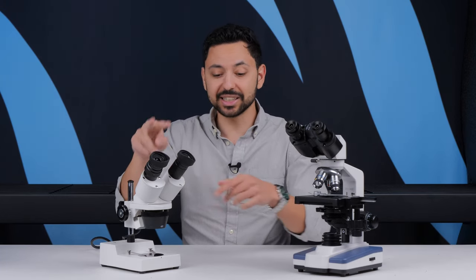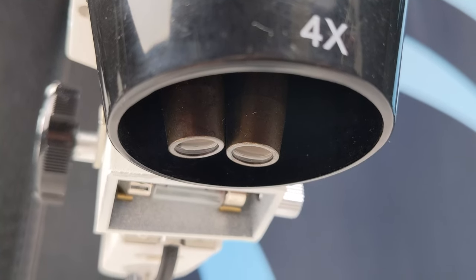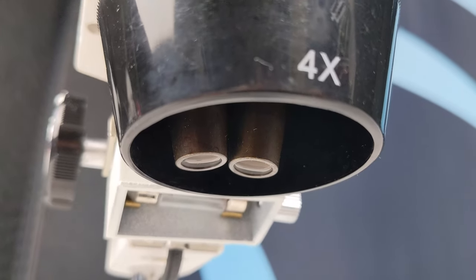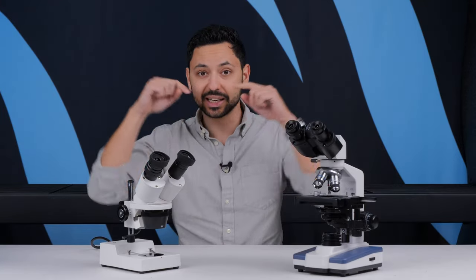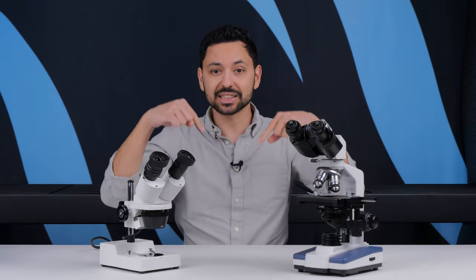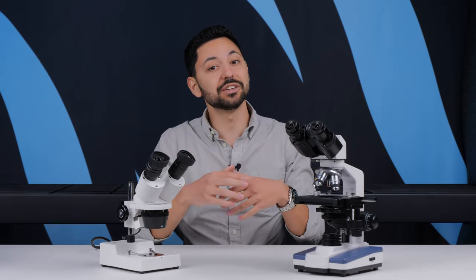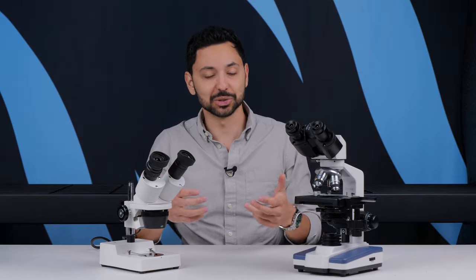Whereas this one actually has two objectives underneath this little black piece here. So essentially each eye gets a slightly different version of the image, which gives you three-dimensional viewing capabilities.